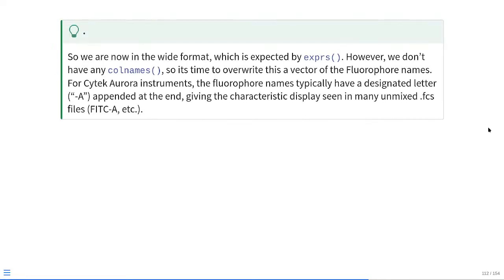So now that we're back in the wide format that is expected for exprs. However, our particular data frame we're working with right now doesn't have any column names, so it's time to go ahead and take that vector of fluorophore names and paste them back in. One thing to note for Cytek Aurora instruments, when you're carrying out unmixing in SpectroFlo software, the fluorophore name ends up having a designated letter at the end, in this case often like -A, designating which parameter was used in the context of the unmixing. So you would see something like FITC-A, PerCP-Cy5.5-A, etc. So we should probably do the same just so we don't encounter any weird, quirky bugs if we ever try to bring these files into the commercial software later on in the future.